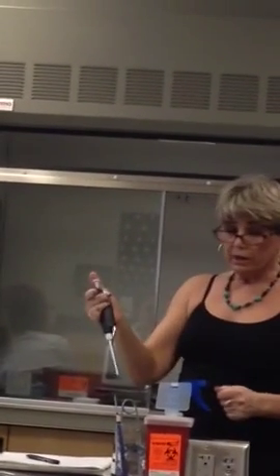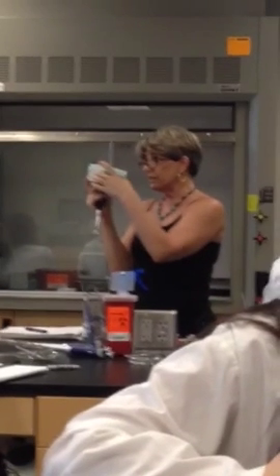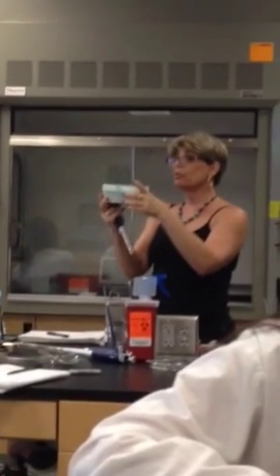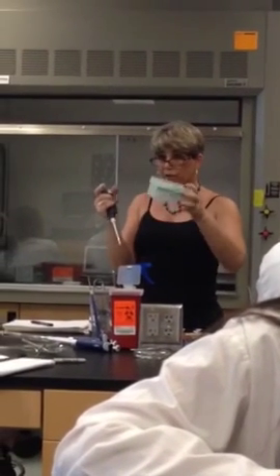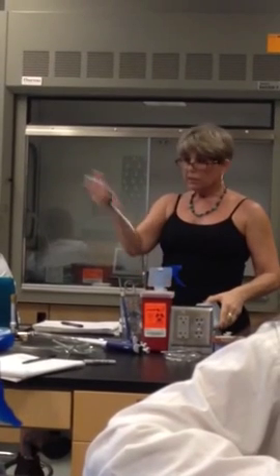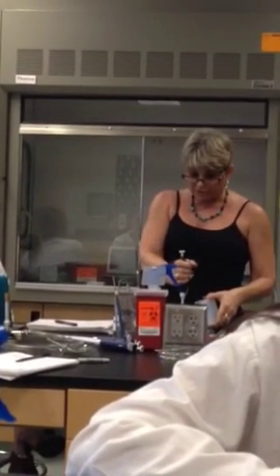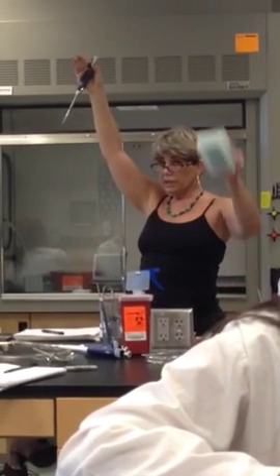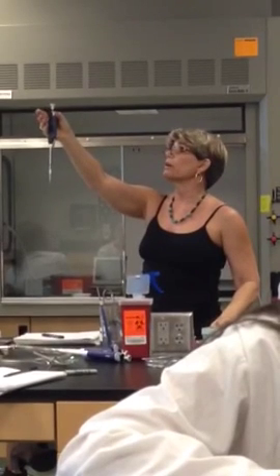Okay? All right. These tips are sterilized. Whenever you see a piece of tape like this on something, that means it's been through the autoclave. It's been sterilized. So you want to keep these as sterile as you can. So do not open the box and leave it open. Open the box, put your pipetter into a tip. Close the box. Now I have my tip on it. I never touched my tip. And I kept my box closed as much as possible, right?